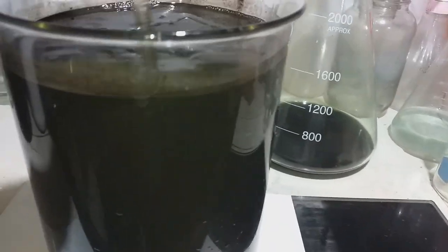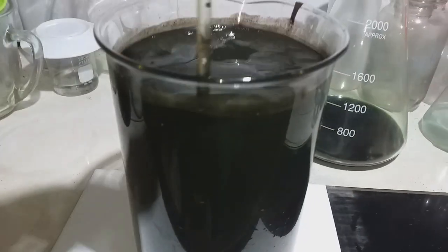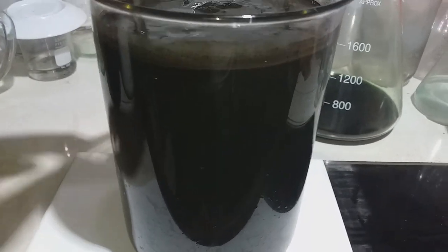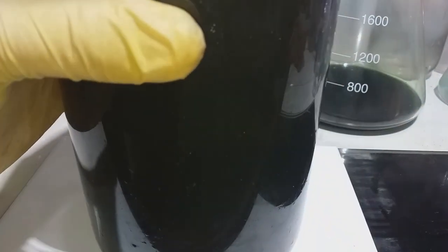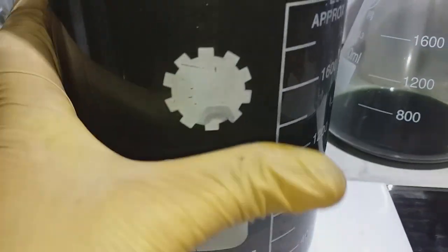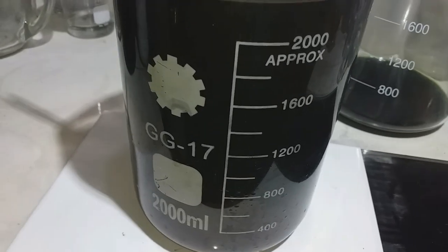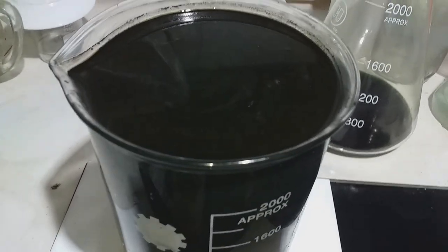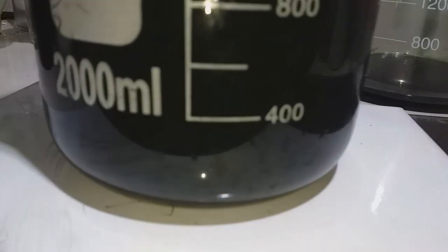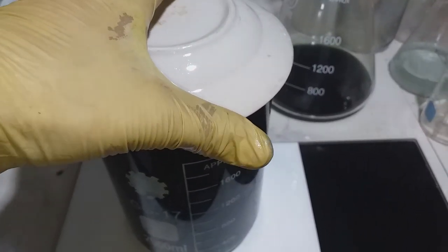We leave this and wait for three days to complete. Almost two liters — more than two liters. Leave it for three days and let's see what happens.